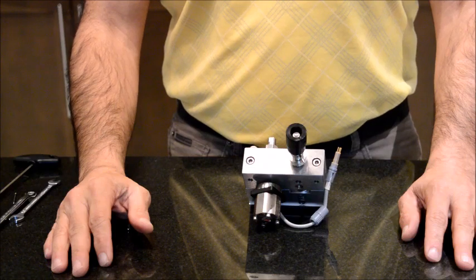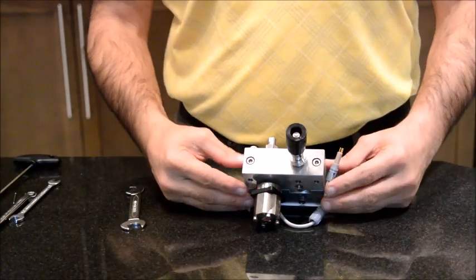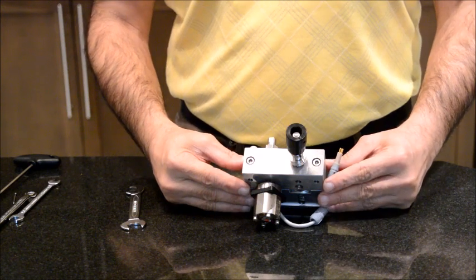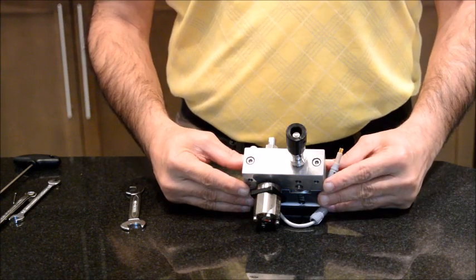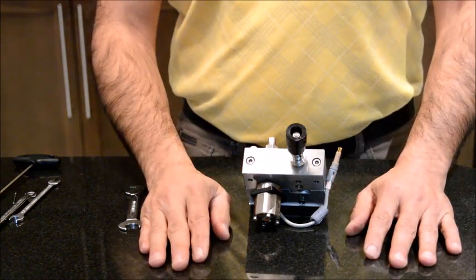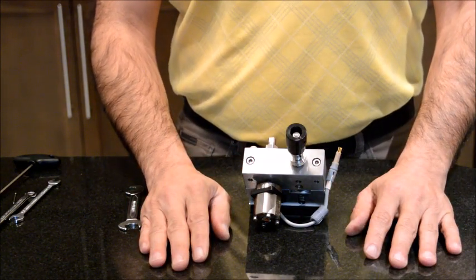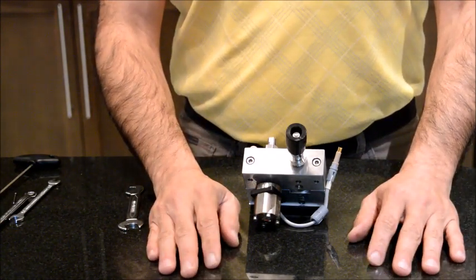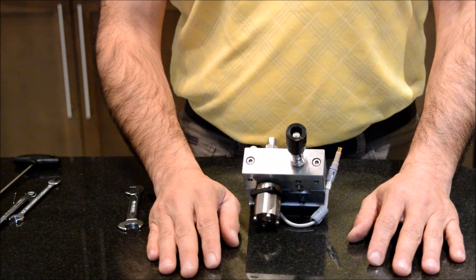Today I'm going to talk about the HPLC pump head and the problems that you may encounter during your HPLC run that are related to the pump head. This video is not meant for calibration analysts, since they already know about this component and their knowledge is much higher than what I know.